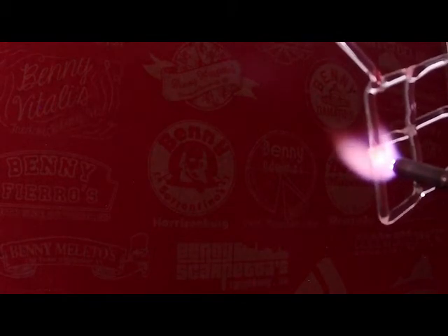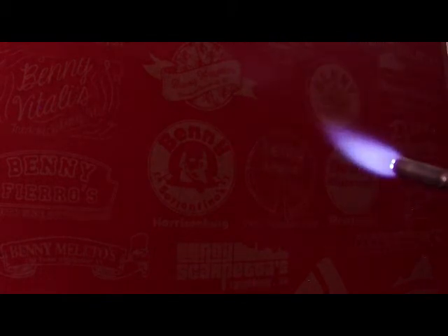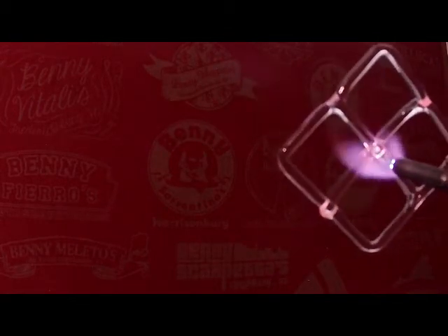In other words, if I'm positioning the glass, if I'm holding it with my left, I have to be really careful right now, not just because of the torch, but because I don't want to smack the camera. So for me, I'd rather just do it all with my right and go from there. So both welds on the ends, actually this one's not so good, but both welds on the ends are decent, and I will come back to them one more time, but now what I want to do is focus on this weld in the center.